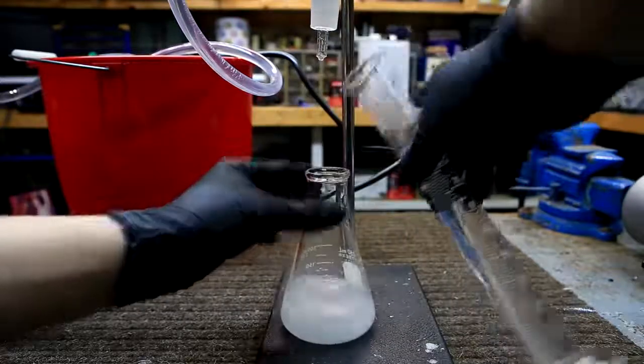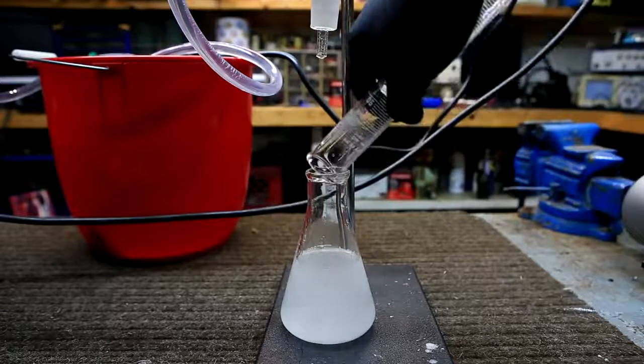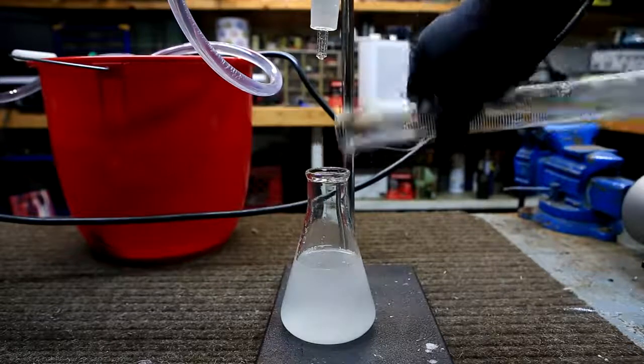You'll notice that this next batch of distillate is clear which indicates a low concentration of cinnamaldehyde oil. Nonetheless it was combined with the previous distillate.